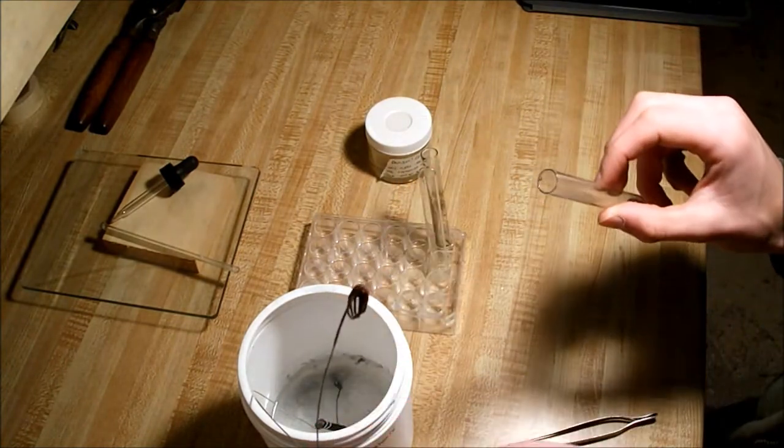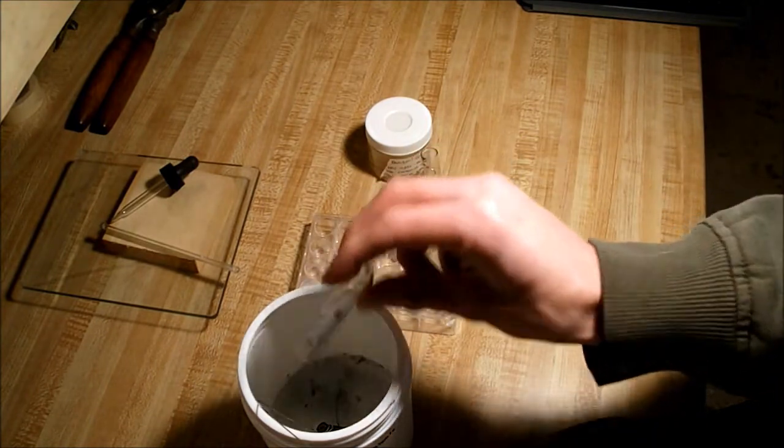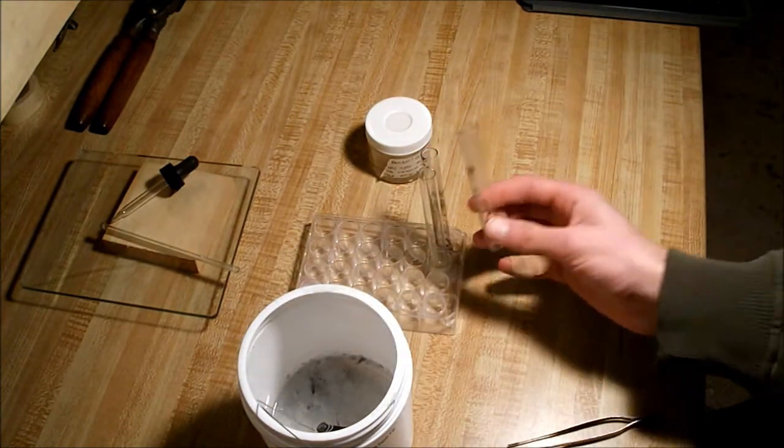And finally, our copper-covered wire, drop that in, and our aluminum chloride that was left over.